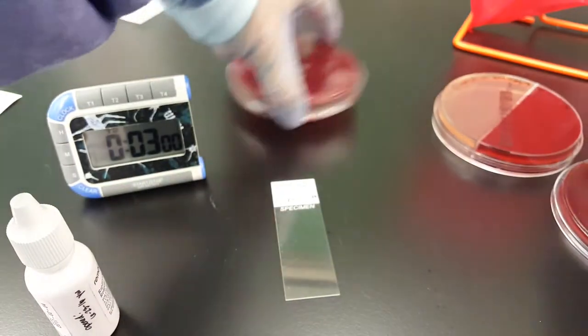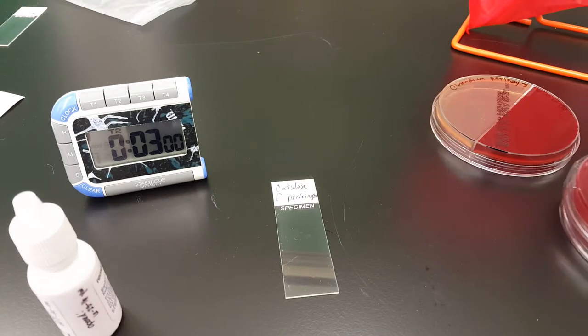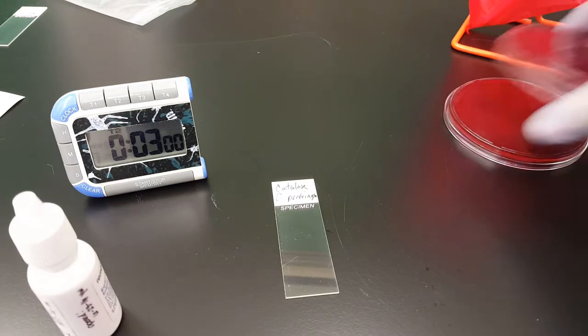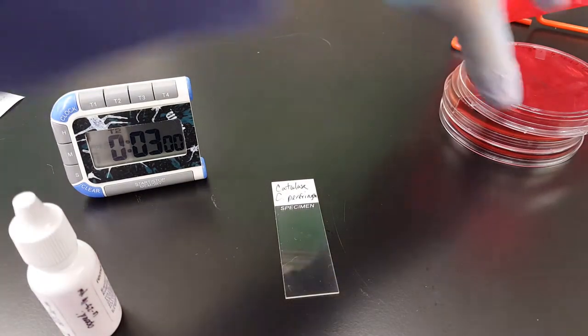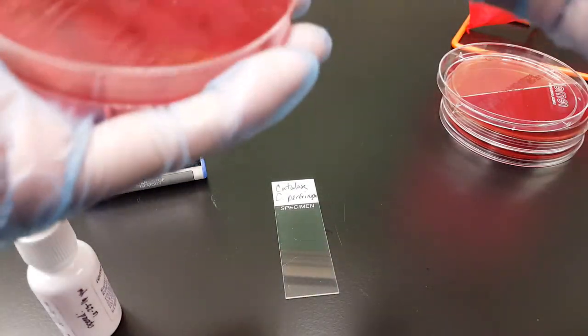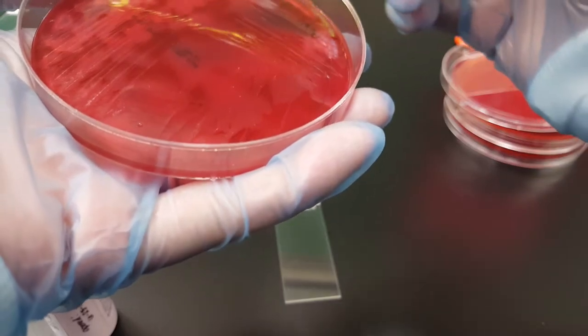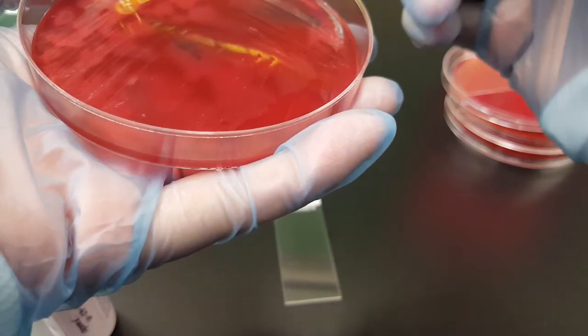So we're going to do the catalase test first. I'm going to get my inoculation loop, shake it out. I'm shaking it off. All right, so I'm going to get some out of the heavy area.